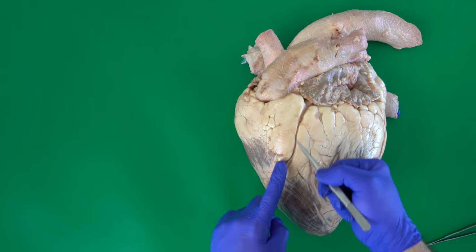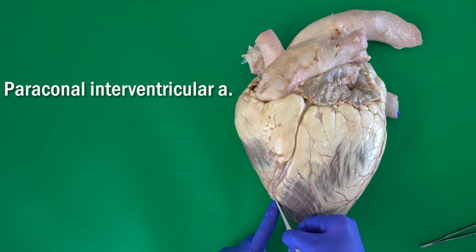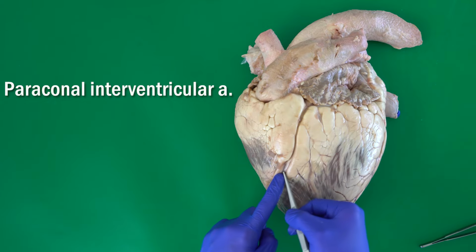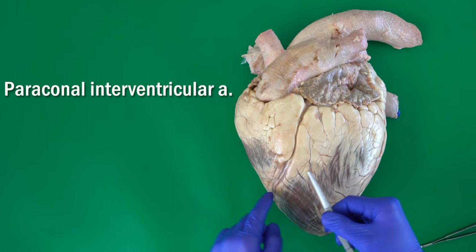They have somehow the same name. So the artery is also called the paraconal interventricular artery, or branch, inside, of course, this groove.